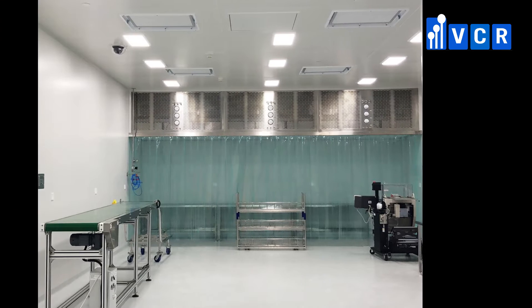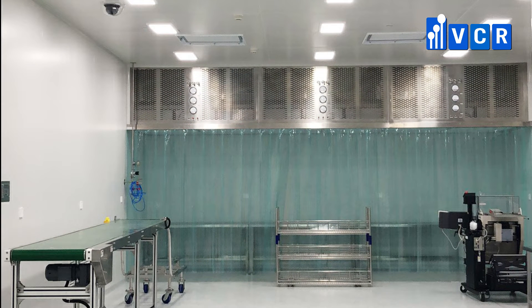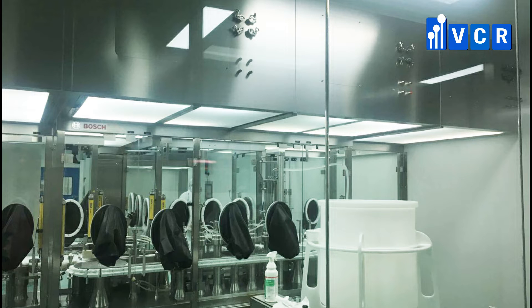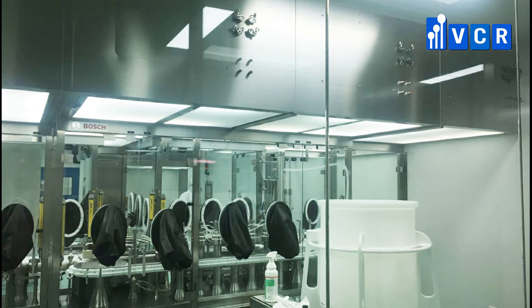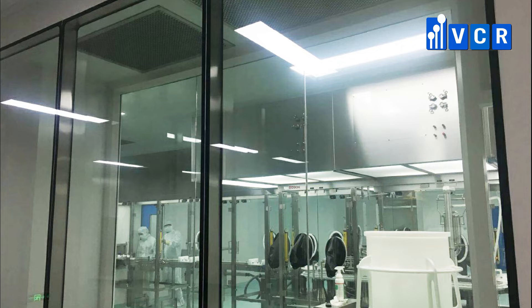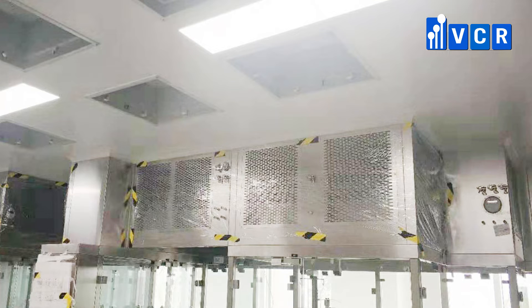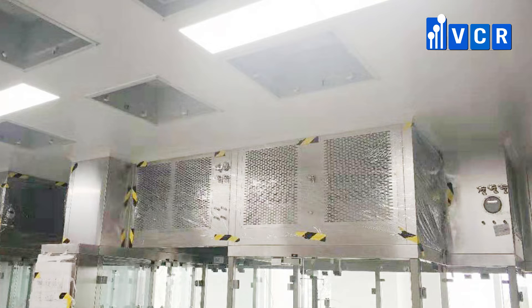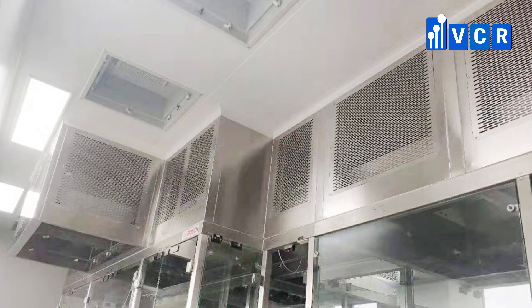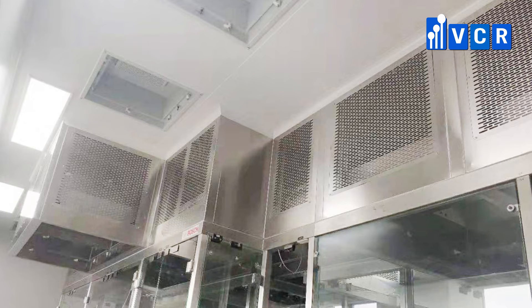Laminar Airflow is a device designed to prevent the equipment and working environment from particles. Laminar Airflow cabinets create particle-free working environments by projecting air through a filtration system and exhausting it across a work surface in a laminar air stream. They provide an excellent clean air environment for a number of clean room requirements.